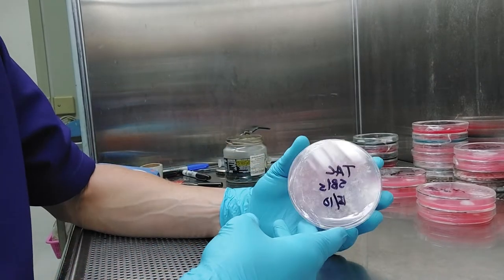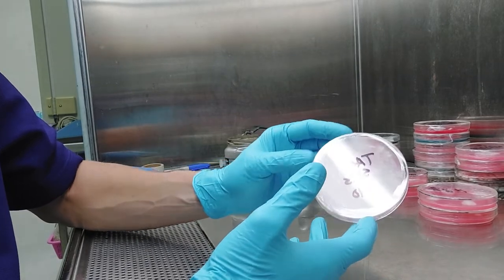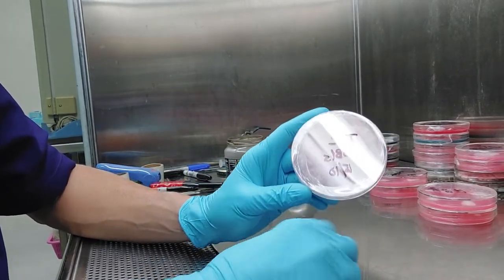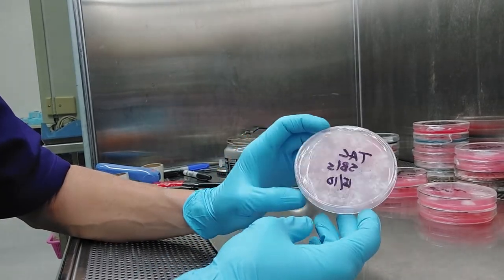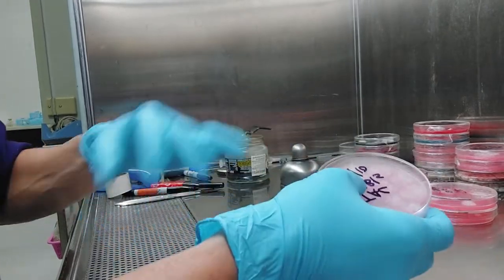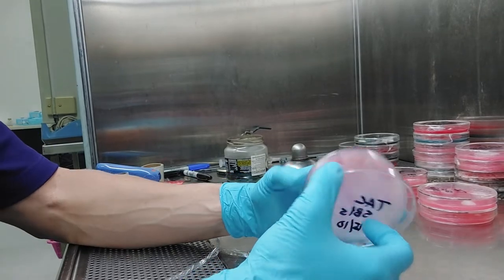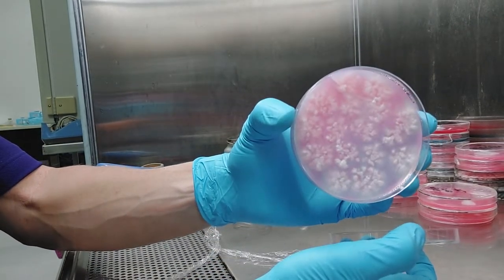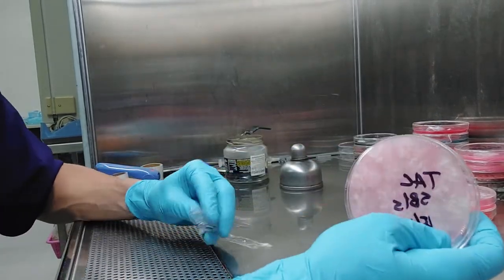So what I did is I basically took spores and I diluted them in sterile water, and then I spread them on a plate. When I did that, I did it a little bit too densely. And so what I ended up getting was something you can see. I've turned off the laminar flow hood and I've already done my real work.